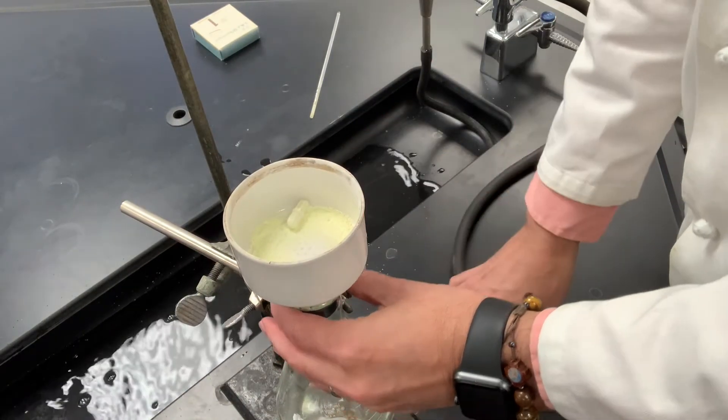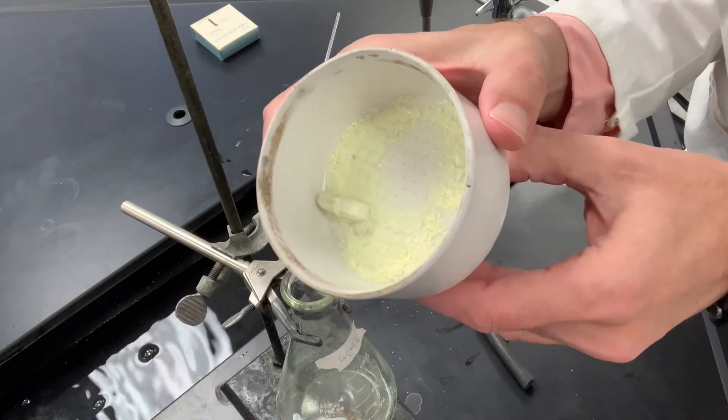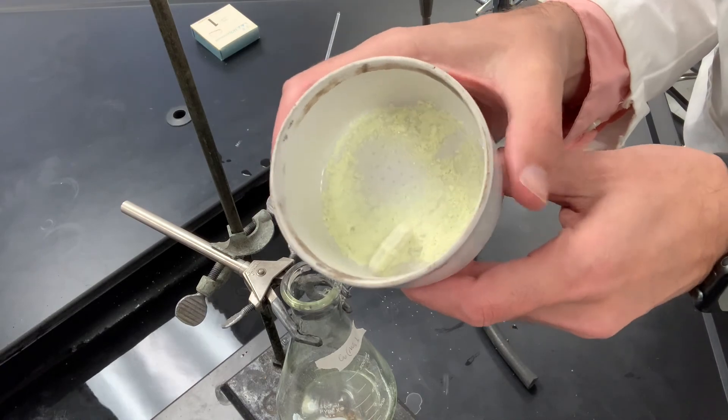Five minutes later, alright that's it for this one. That's what this substance looks like there - it's kind of a pale, very pale light yellow color.